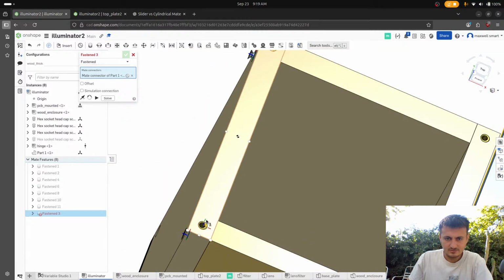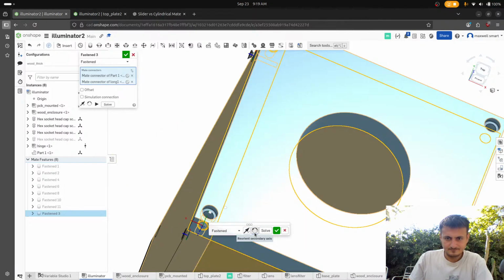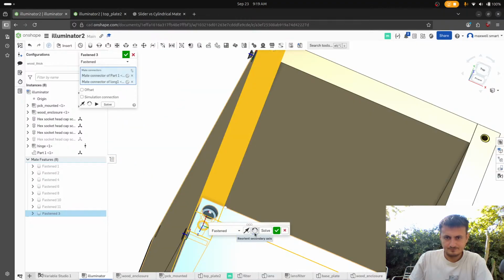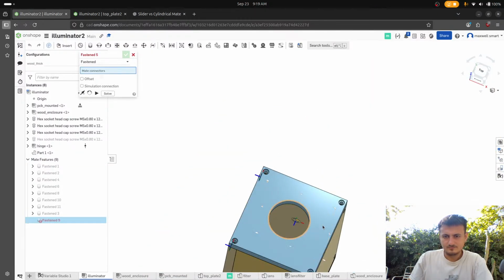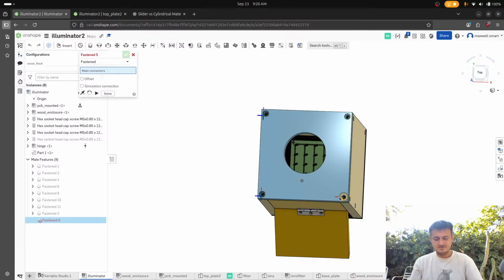What the hell is going on here? Oh, shit. Okay. I don't know if I'm gonna have room for this. This thing, man. Because, okay, this is sitting like this. So what we need to figure out is... Actually, we might have room.